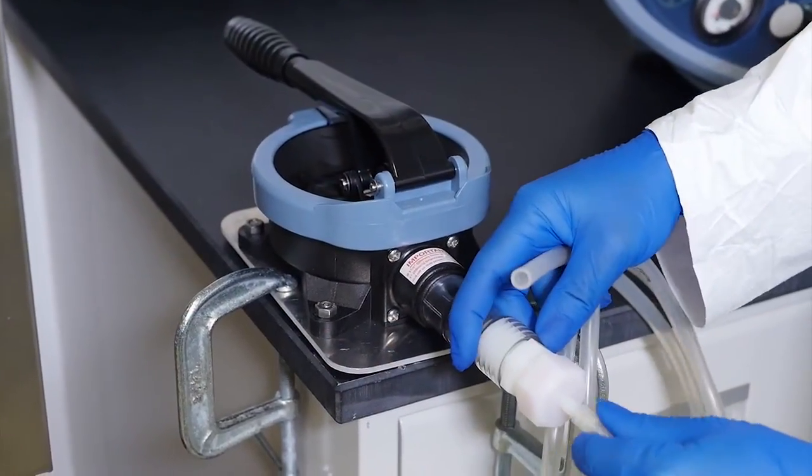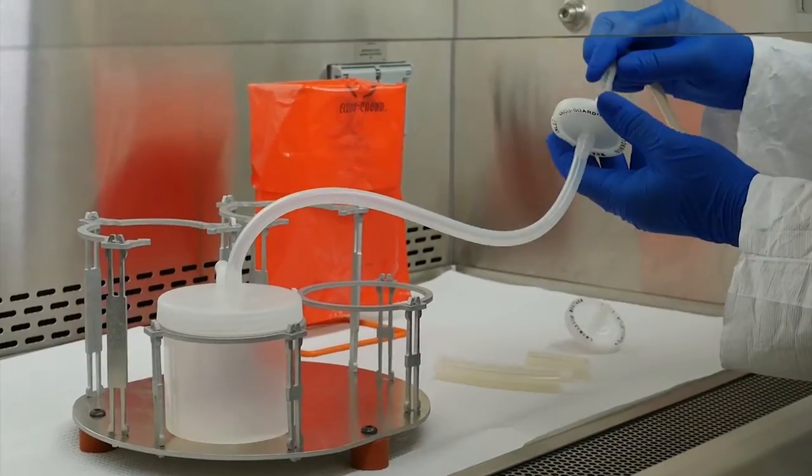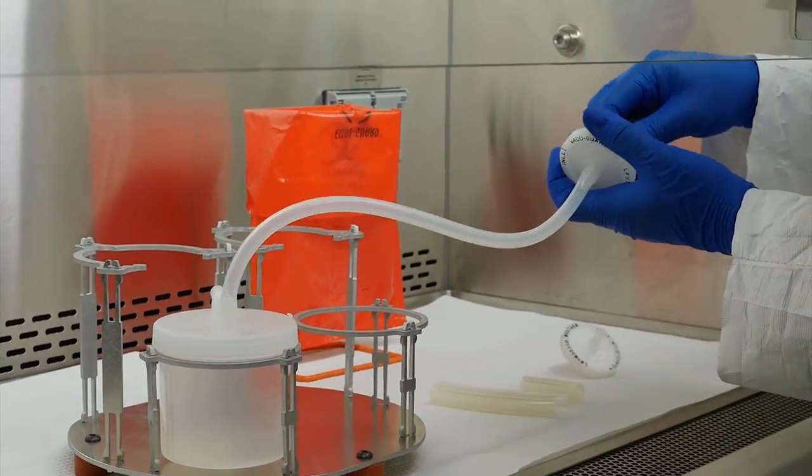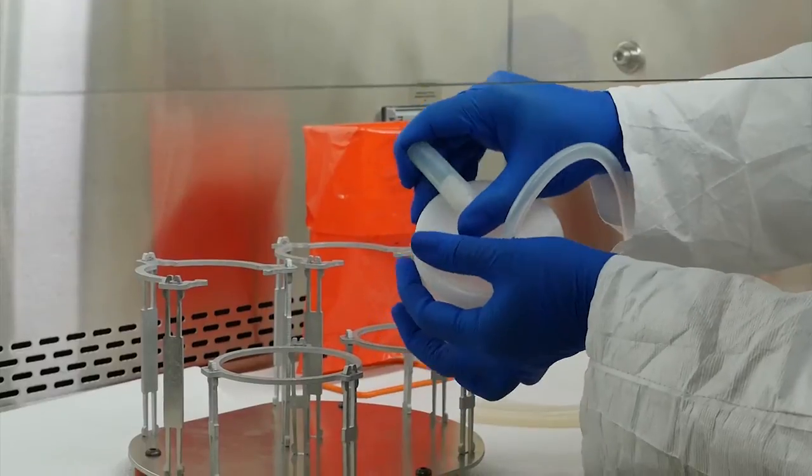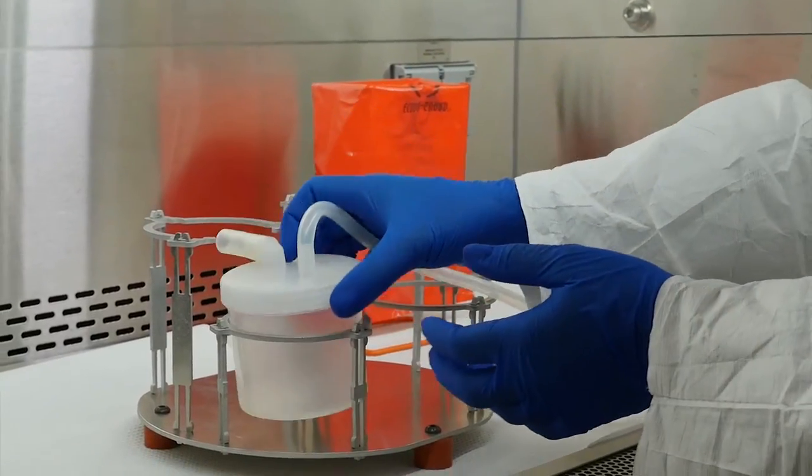Finally, connect the very long, small diameter tubing to the bilge pump and the VacuGuard filter. Attach the very short, wide diameter tubing to the collection cup lid's elbow inlet.